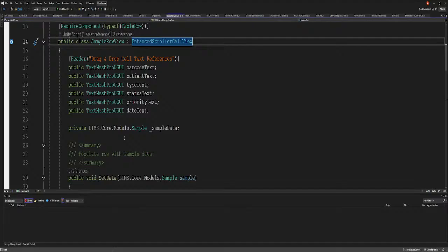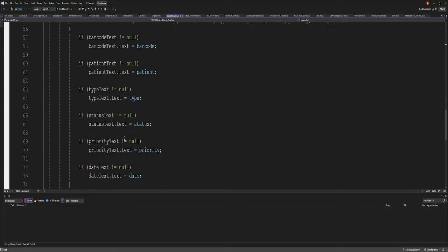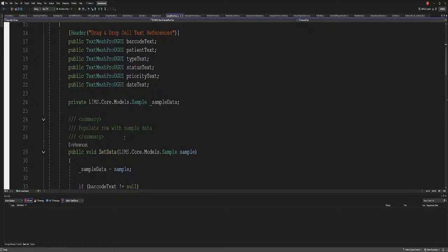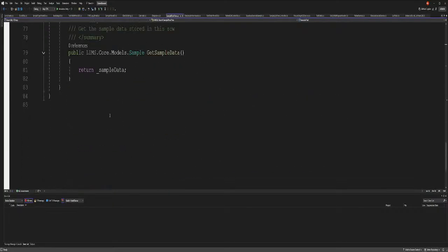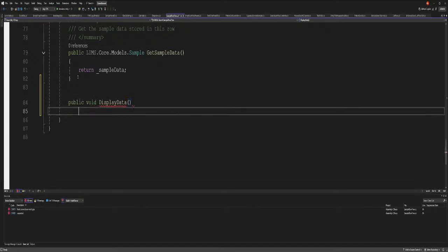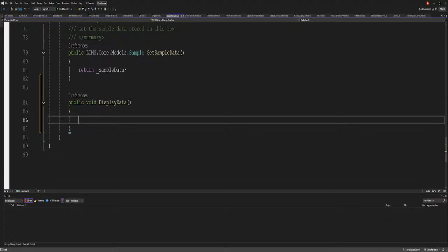We already have the data here. That's why I'm gonna do it here, because we already have the data and all that stuff. Public void display data, right? Display data. Yeah, that's good. Display data. All right, and then the data on sample.